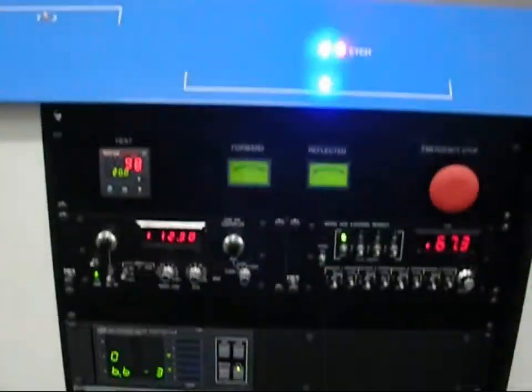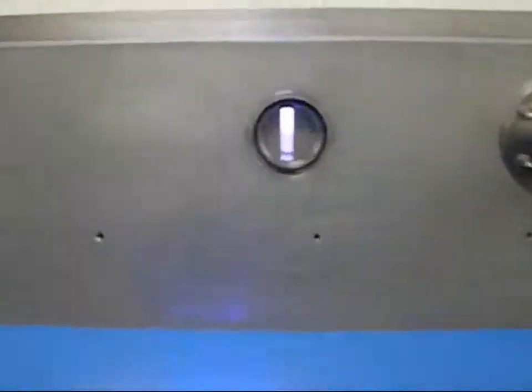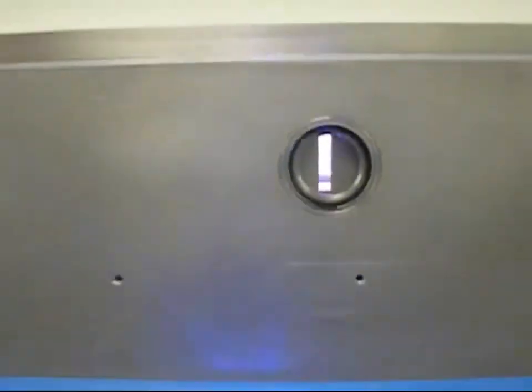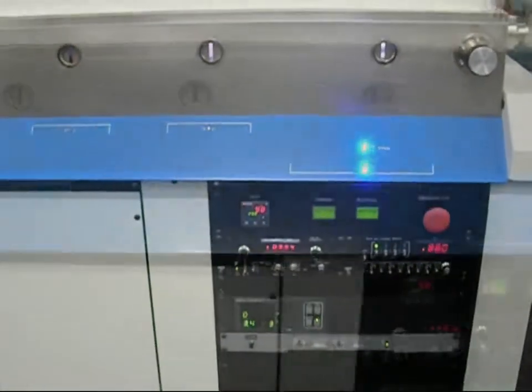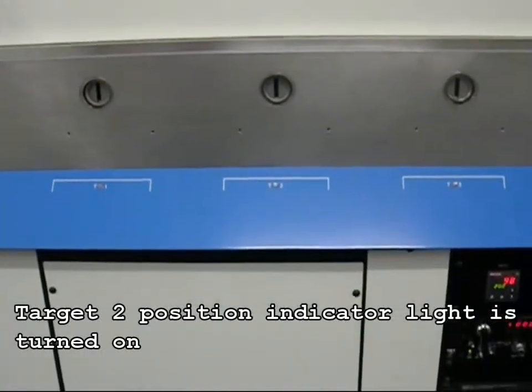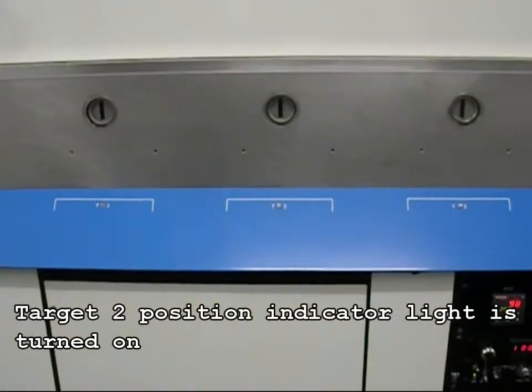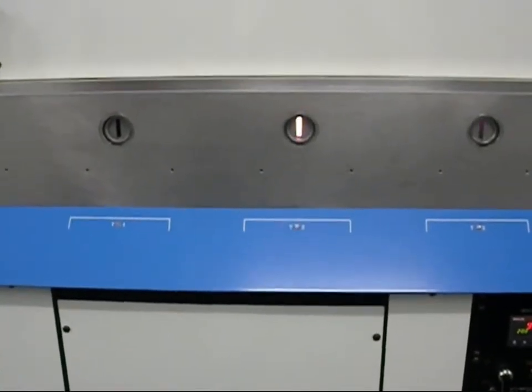Once the RF plasma ignites, the automatic tuning network will tune the plasma. The gas pressure will stabilize and etch the surface of the substrates for a pre-programmed amount of time. Once the RF sputter etch process is completed, the substrate pallet will be realigned under target position 2 and sputtered with RF power. The RF power level is now ramping up.